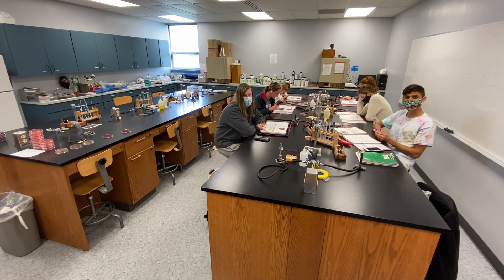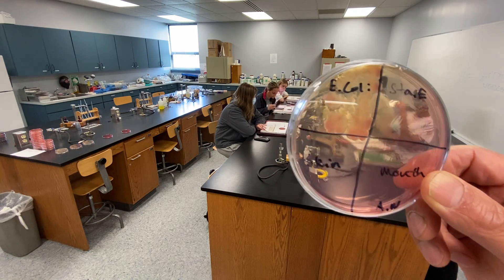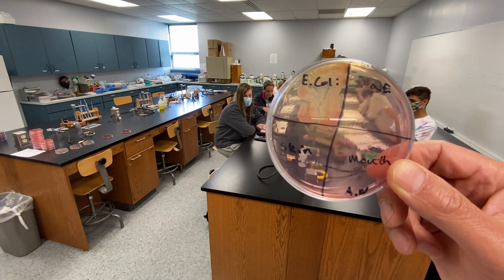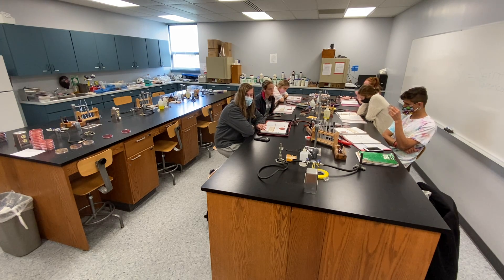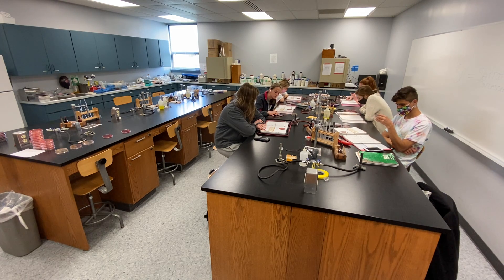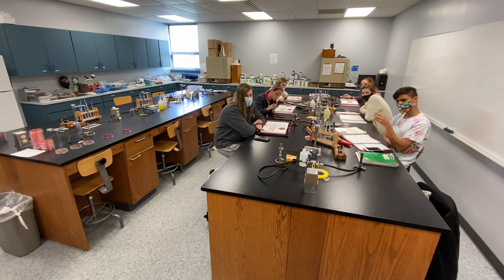If you look at Staphylococcus epidermidis on MacConkey, there's no growth. If you see growth, it's most likely from cross-contamination — you brought E. coli onto your slide. Why does Staphylococcus have trouble growing on MacConkey? It's gram-positive, so what chemicals in the medium suppress it? Bile salts and crystal violet work against gram-positive bacteria.